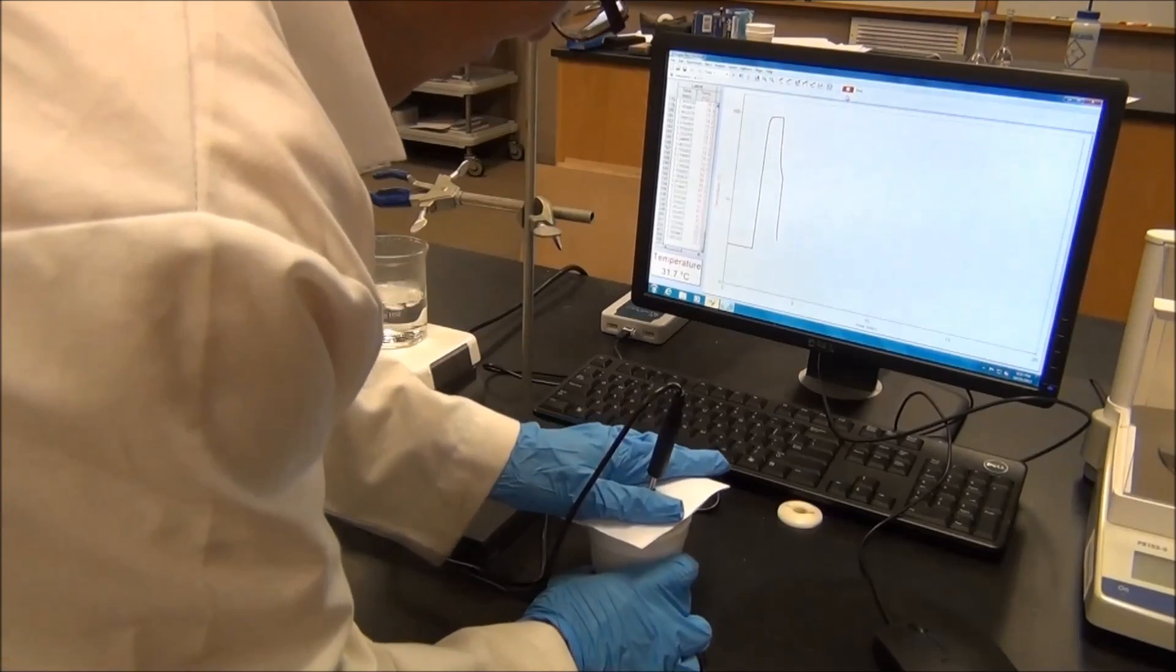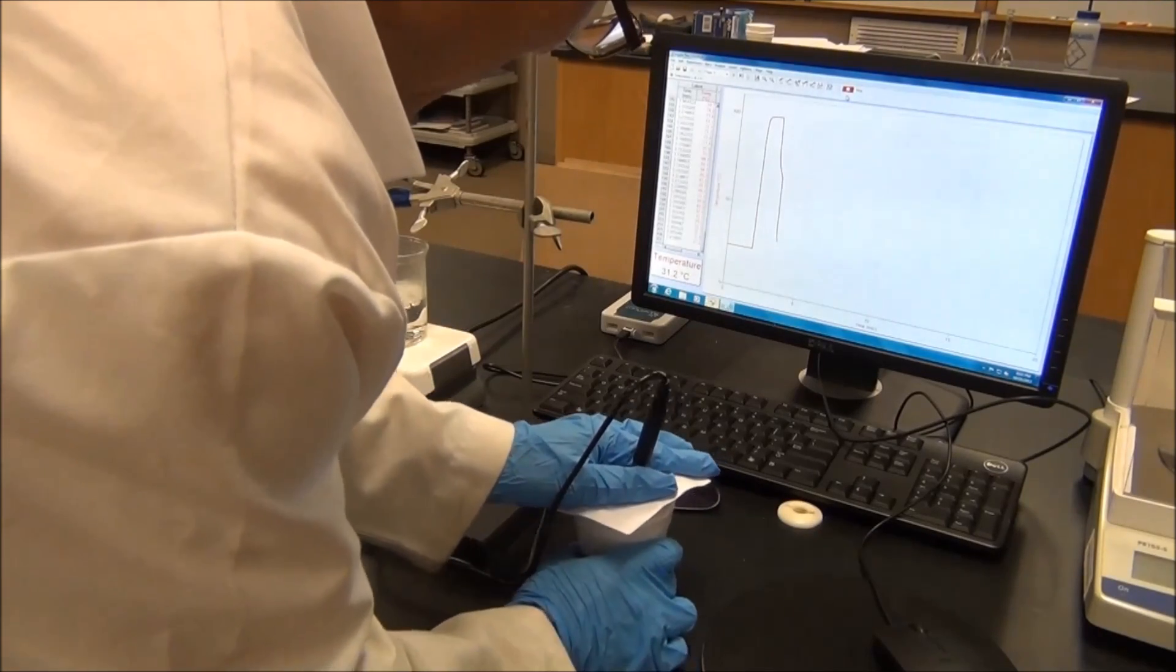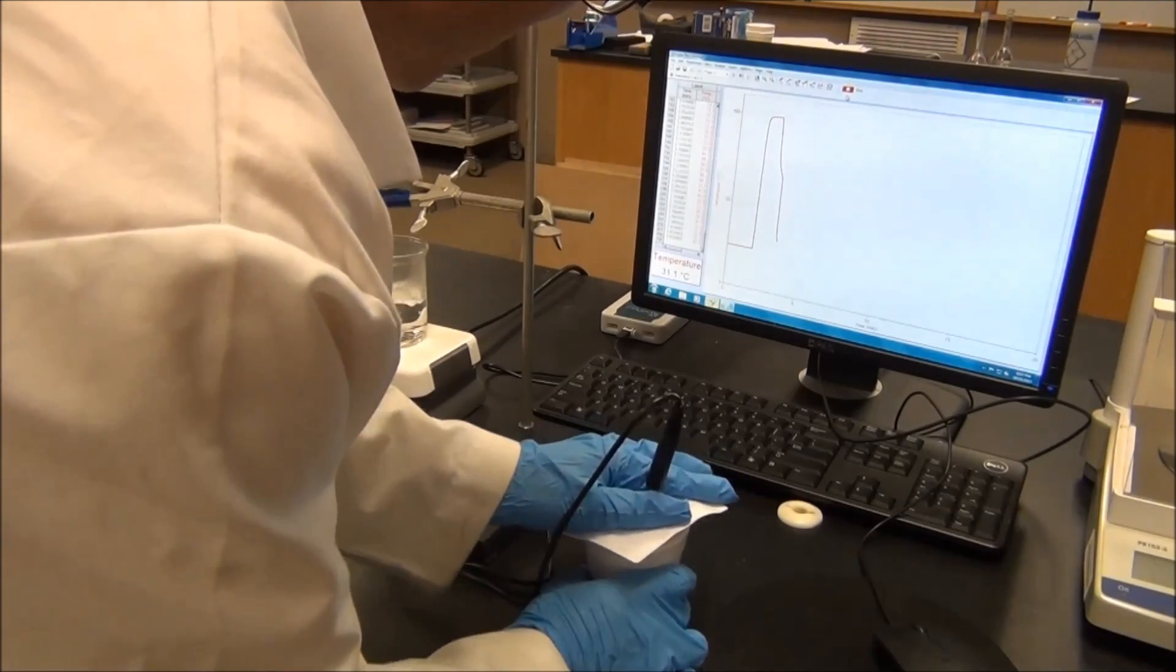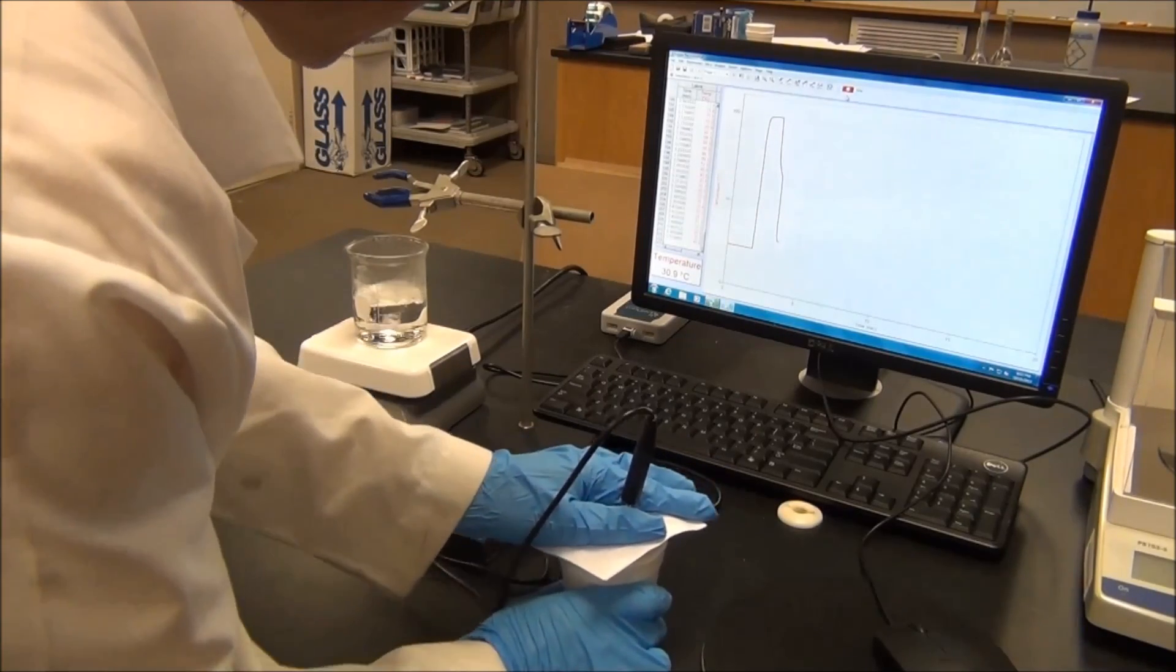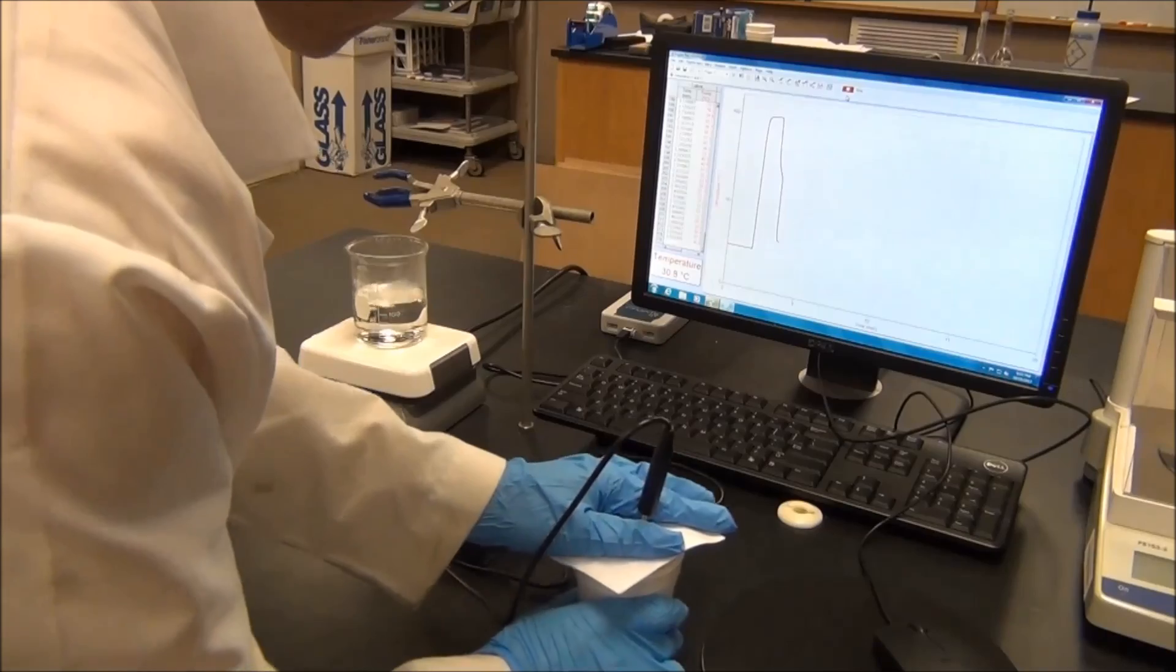And gently swirl, so make sure the temperature transfer is fast and efficient. And then you monitor until the temperature is constant again. And then our experiment will be done.